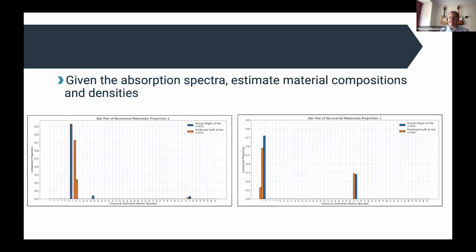The next thing then is, now I not only have my spectra and I know which voxel in my image has different spectra, I can now also estimate what materials they are. So here are the 92 materials, going up to uranium. We stop at uranium. First of all, we don't have data for absorption spectra above uranium. And if you're working with anything higher than uranium, you're on your own.